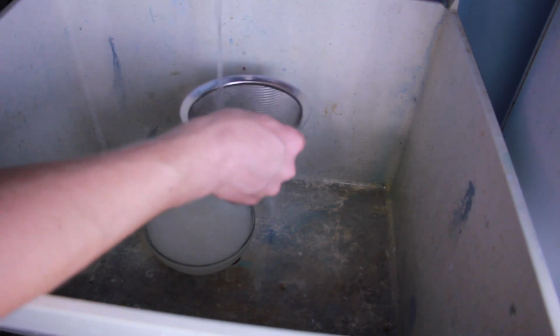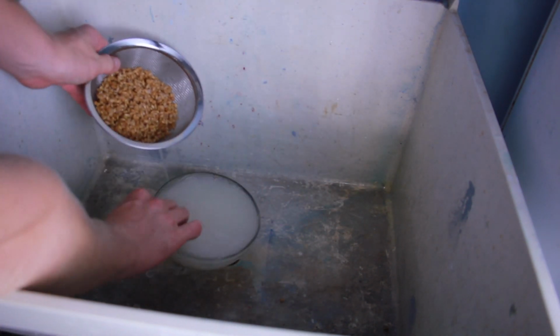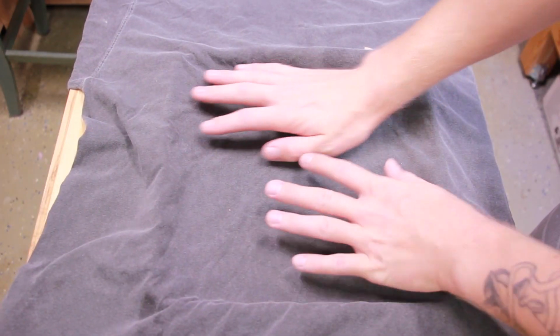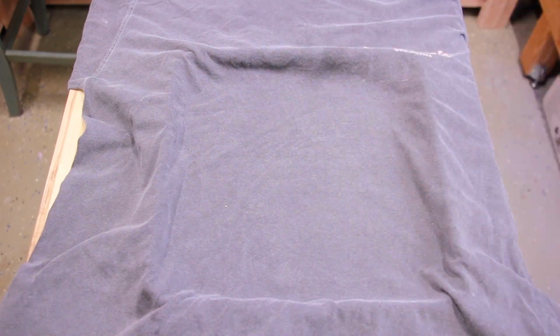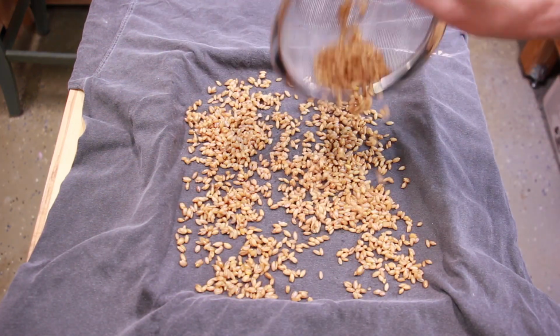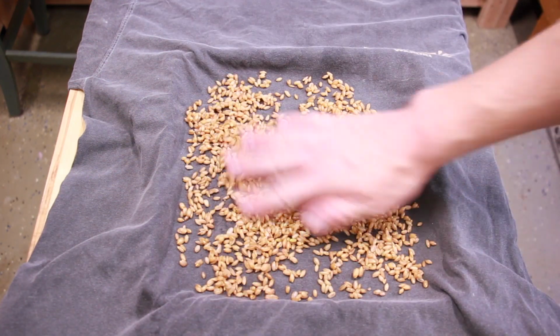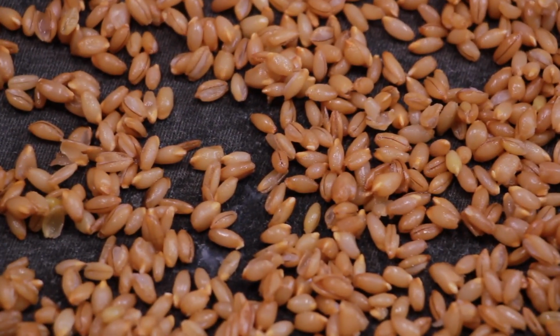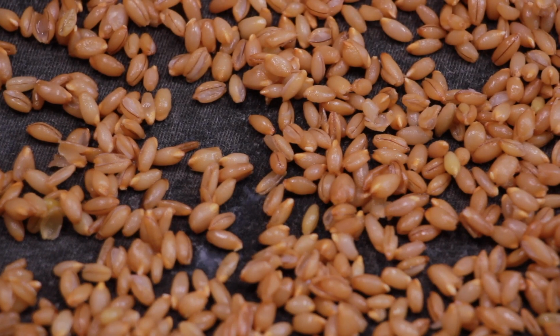I rinsed the grain off with some cold water, and then I let it sit for about an hour to drip dry, and then moved it over to a drying pan, and I put a shirt down to help absorb some of the liquid. In the last project, I had a lot of problems with too wet of grain, so in this experiment, I'm going to try to dry it out a little bit more.